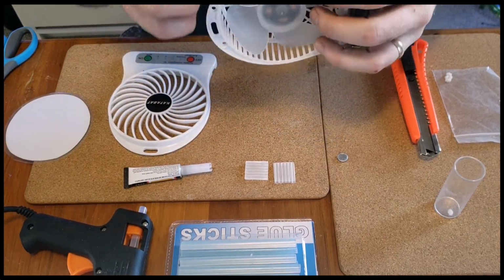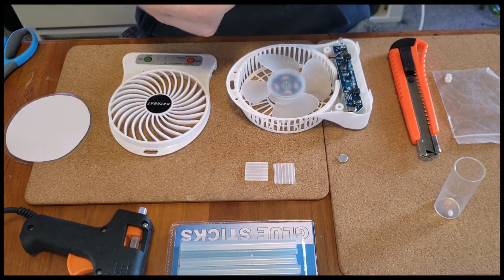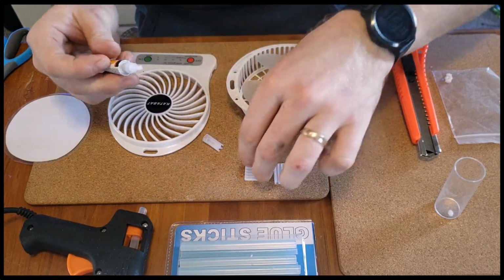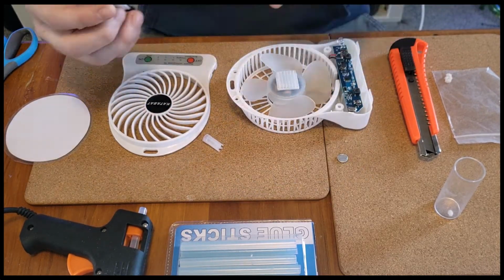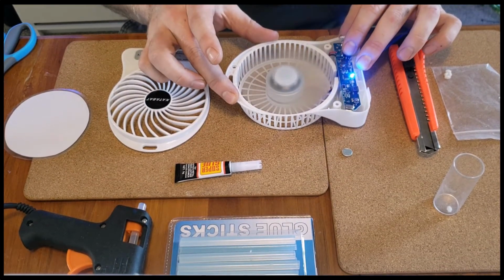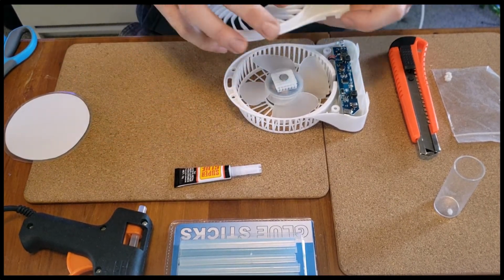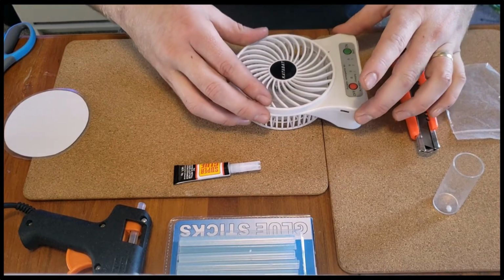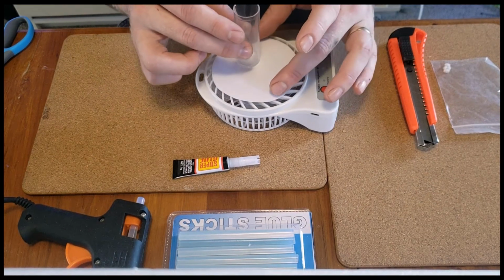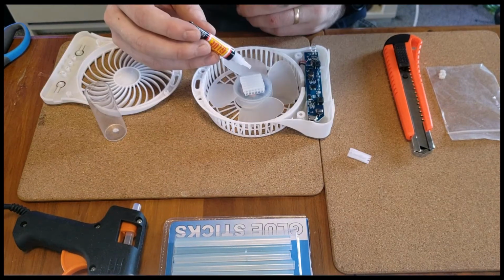You'll notice here that the distance between the top of the fan and the bottom of the guard is quite a distance. Now for the magnet to get the best hold of the magnetic bead, it needs to be close. So I've created 2 little squares of plastic that I'm gluing together on top of the fan to get that magnet closer. Once I'm happy with it, it's time to pop the magnet on top of the plastic and make sure that once the guard and the waterproof membrane layer are on top, that the magnet on top of the fan can grip the magnetic bead. Here you'll see that it is nice and snug.